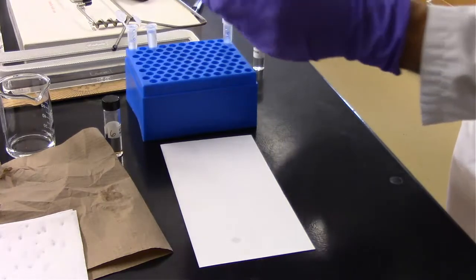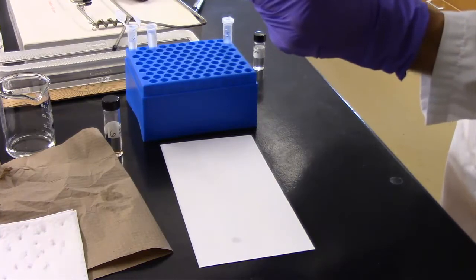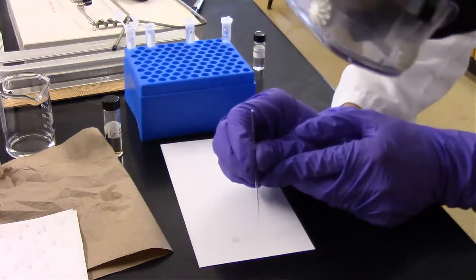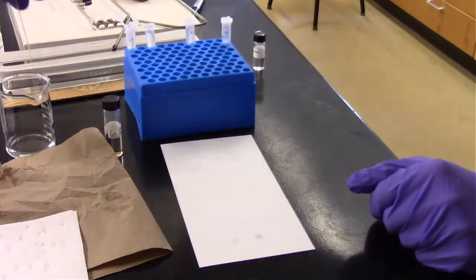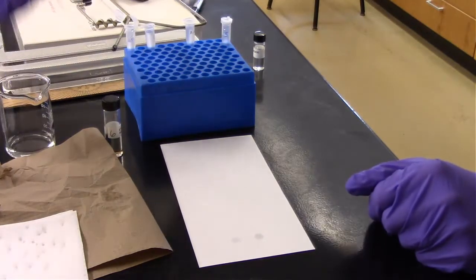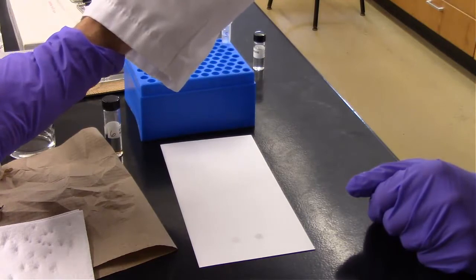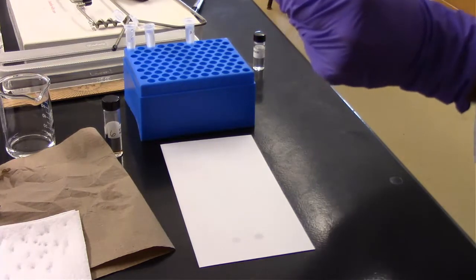And then AA was basically twice as concentrated as recommended. So with this, I'm going to make sure that I only have a very small amount that can run up in here. And when I spot it, hopefully this spot looks quite a bit smaller than what I did for the other one. It's pretty good. So we'll rinse this a few times. And then go ahead and spot our 5 amino acid reference ladder.